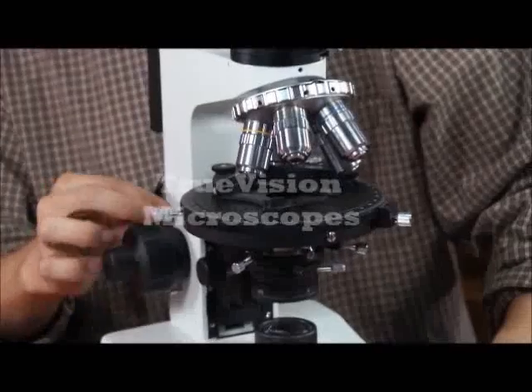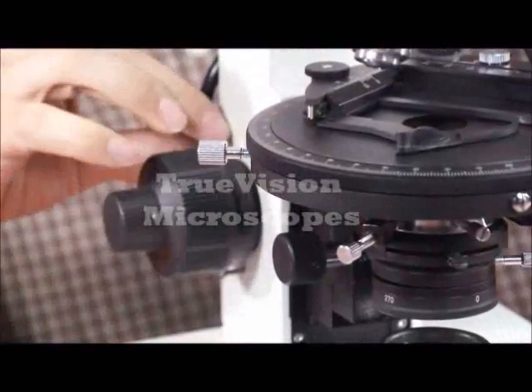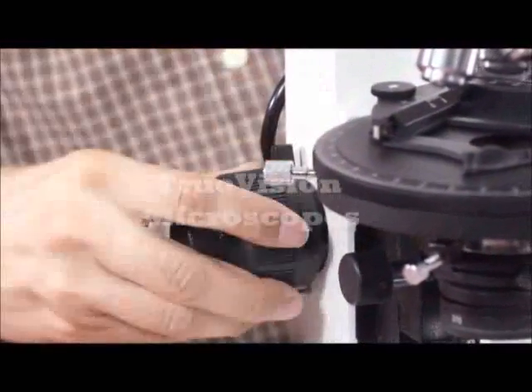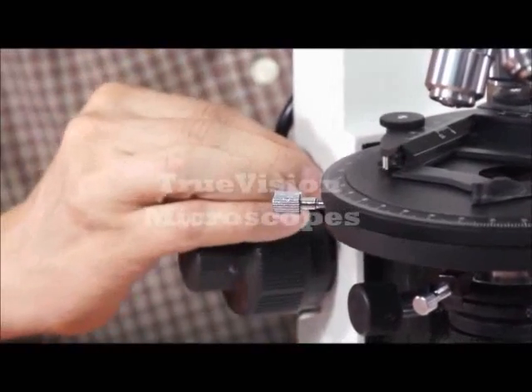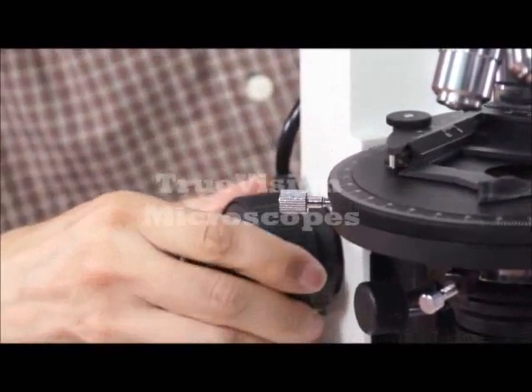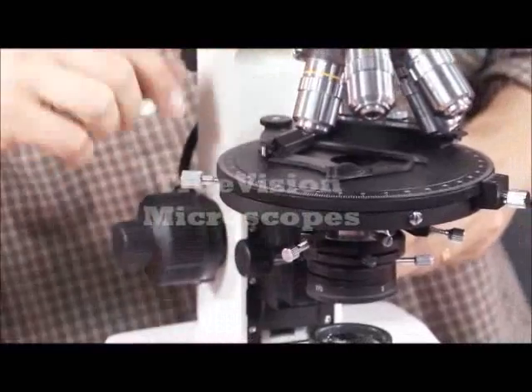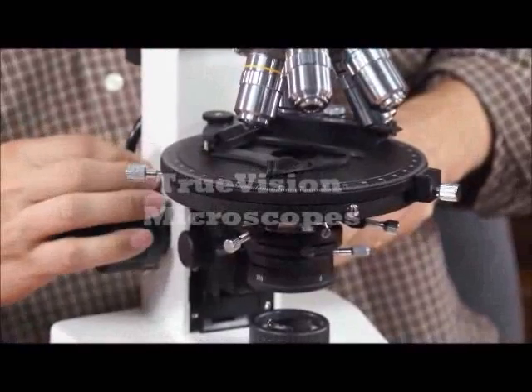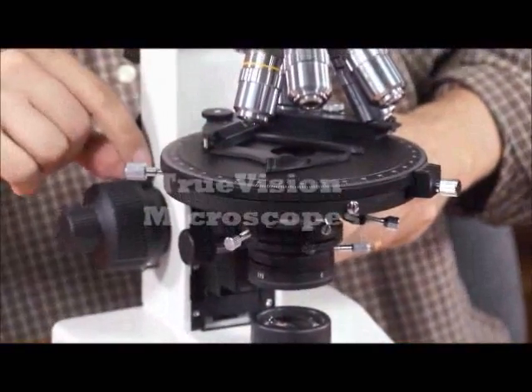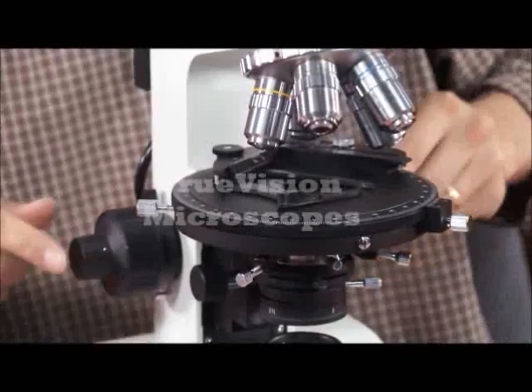This microscope also has a focusing lock stop lever. When engaged, it stops the stage from going higher. Once set, we can't go any higher — I release it to allow the stage to go up higher. This is used to protect your slide and your objectives by setting the distance that the stage can travel. So if you cannot get an object in focus, you might need to release it to get it closer. It has coarse focusing and fine focusing.